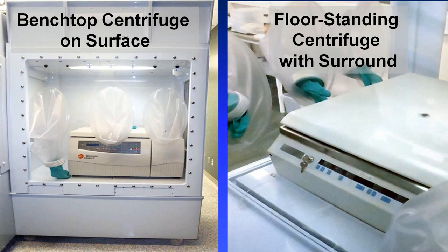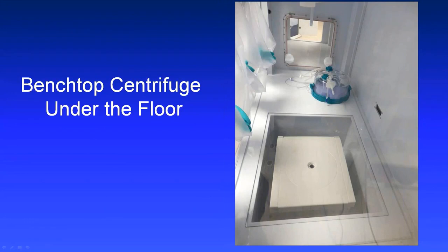We also do benchtop centrifuges. We do that on a lowered surface so that you have plenty of room to open the lid and get inside there to get your samples out. It's lower compared to the processing chamber height. We also have done centrifuges underneath the floor of a processing chamber like this. So you can put the lid down and you can do some more work while the centrifuge is running.